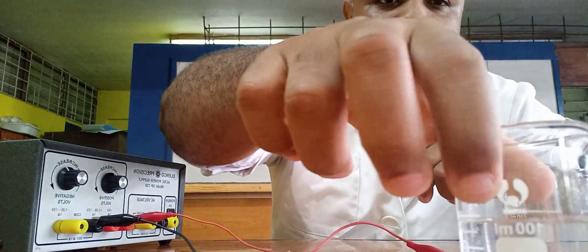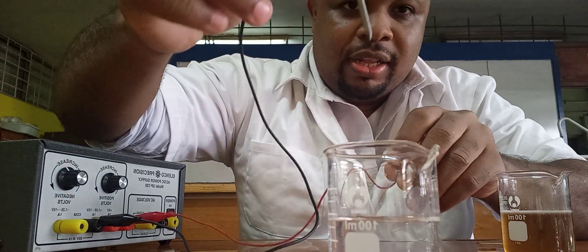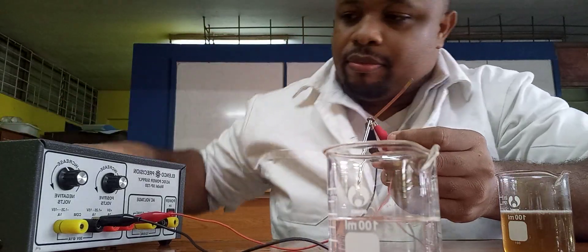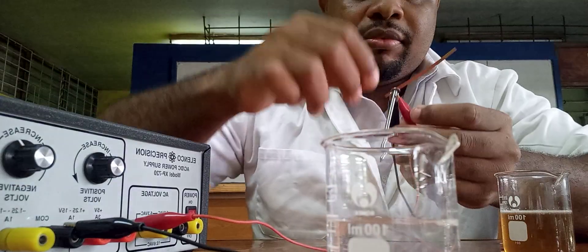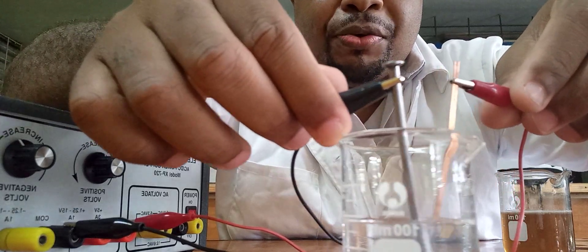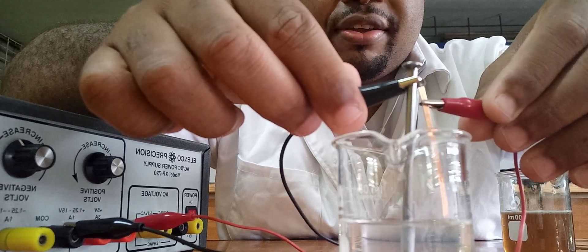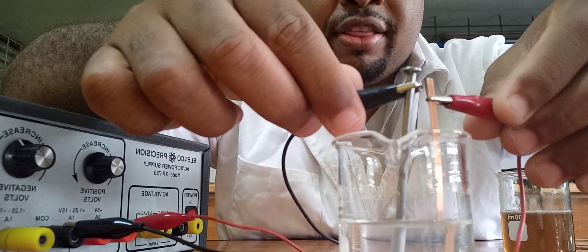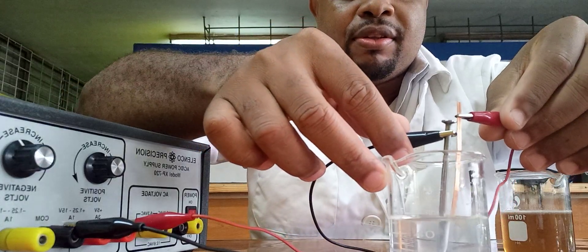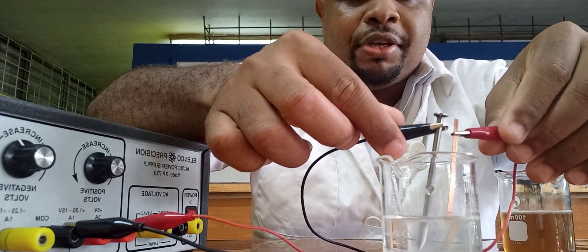I am going to put it close. What you are going to look for is the production of bubbles — pay attention to the nail and the copper metal as I put them in the solution. If you look at the nail inside, you can see the fizzing occurring. You will see the formation of bubbles — it is clear to see. Once a reaction is taking place, it means that the electrolyte is being decomposed.